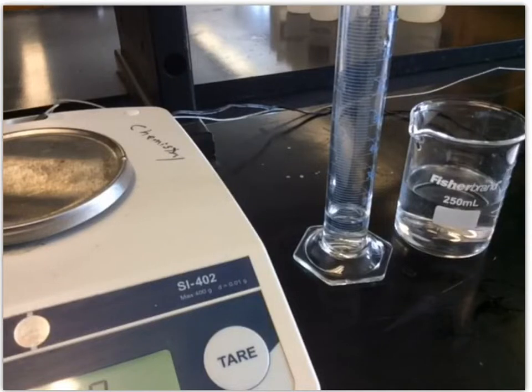Once you have those masses and volumes, you can divide and it will give you density. So you'll do that for every single trial. You'll get a density for trials one through five, and then you'll average those. All of that information, you're going to enter into your assignment on Blackboard, the lab assignment. I have posted a data sheet just to help you organize the data. You don't have to print it out because you're going to be typing this into Blackboard, but it gives you a general idea of how to lay out the data. Right now, we're just collecting the masses and the volumes, the rest you need to calculate.